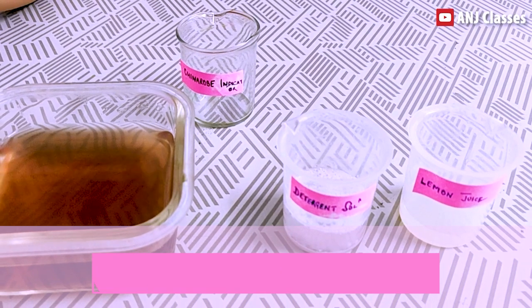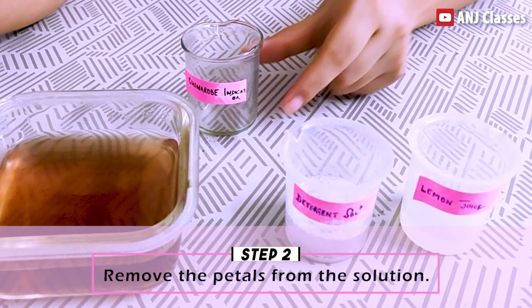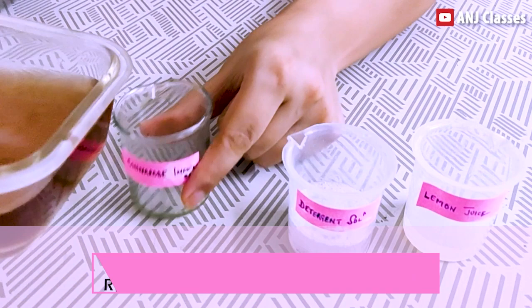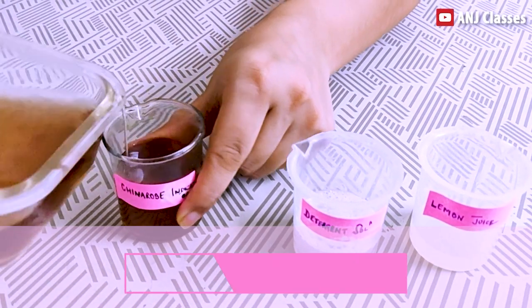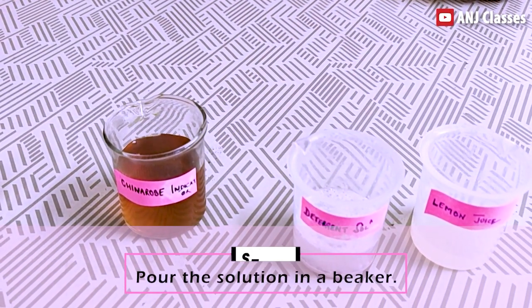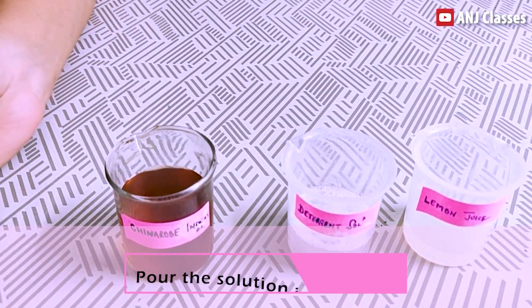The next step is to remove the petals. As I have already removed them, I will now pour this solution into my beaker. This is my China Rose Indicator.